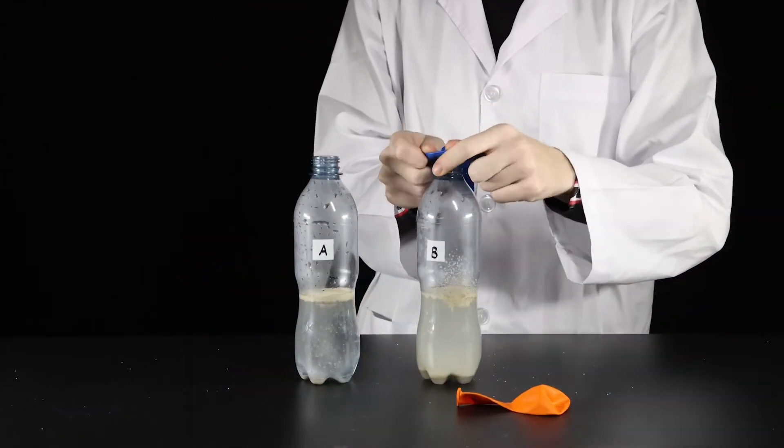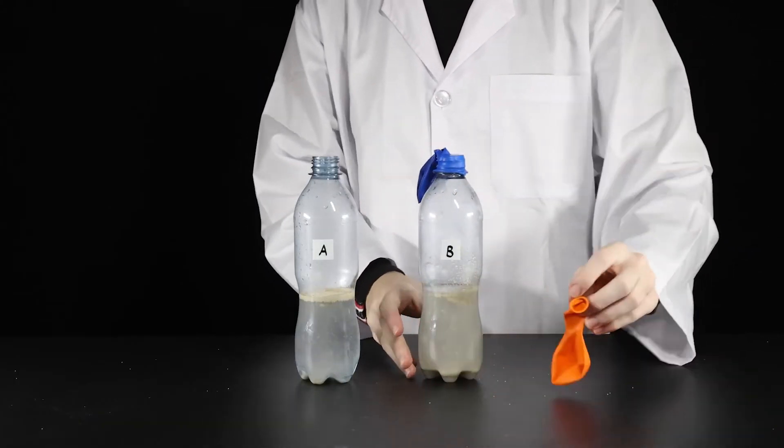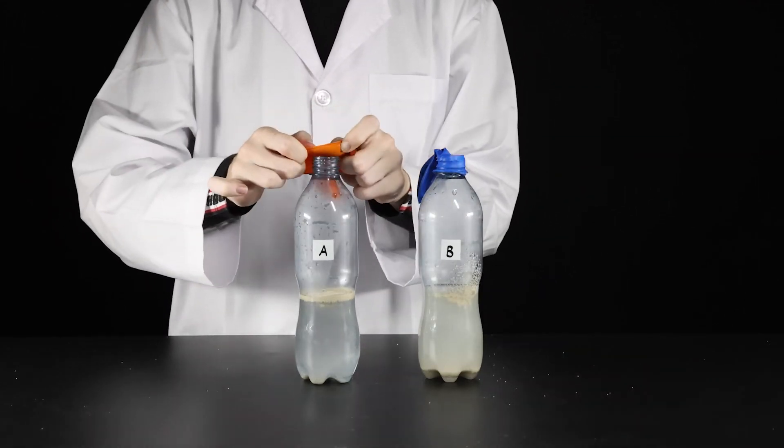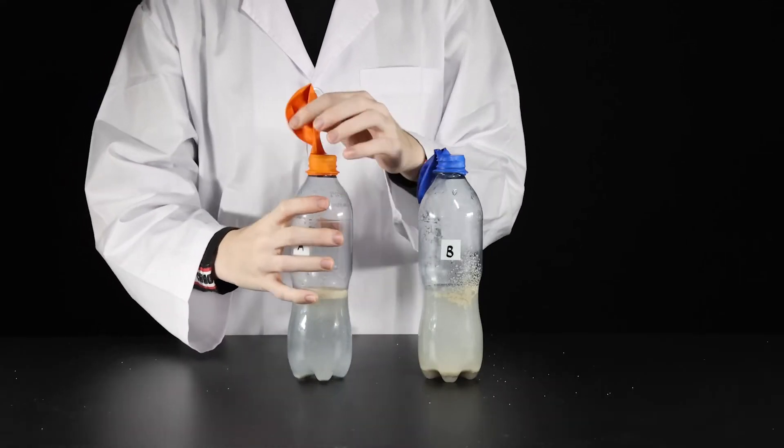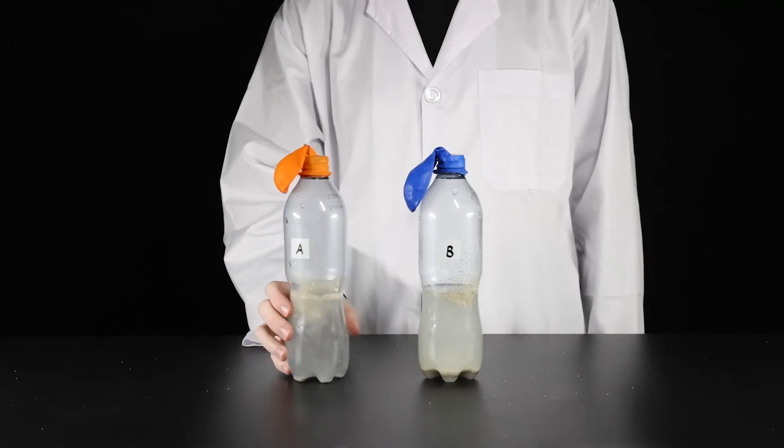Seal the bottles by placing a balloon over the opening. Shake the bottles every 30 seconds.